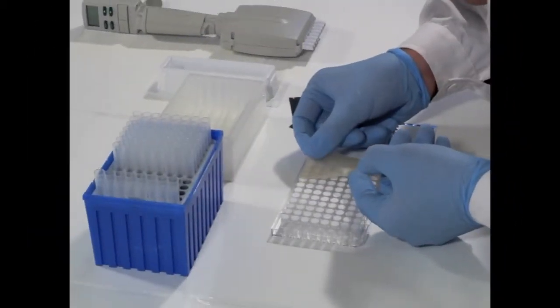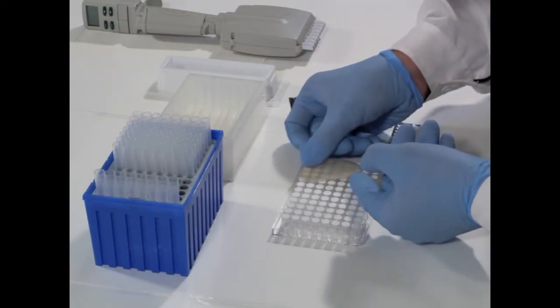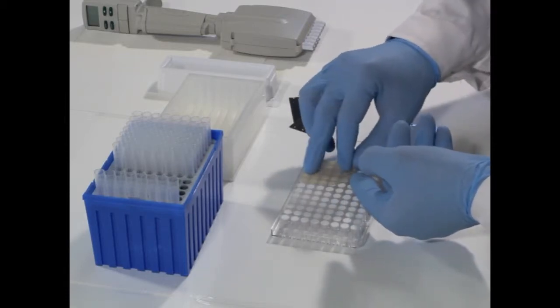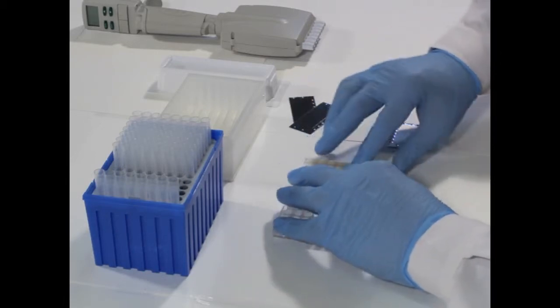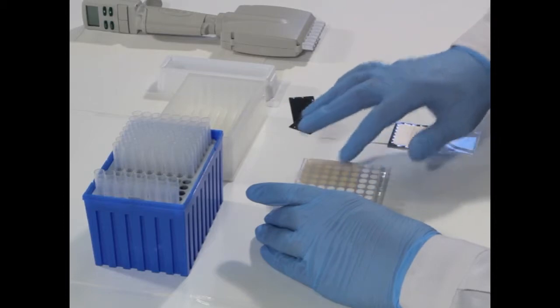Patches are applied on the bottom side of the membrane in such a way that will completely cover most of the wells. Patches must be pushed firmly on the membrane to ensure complete adhesion.